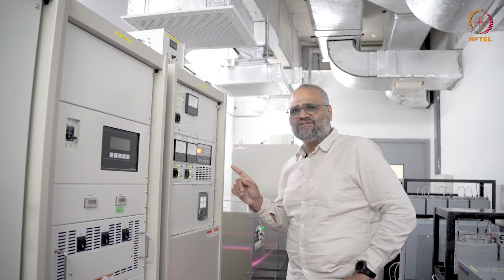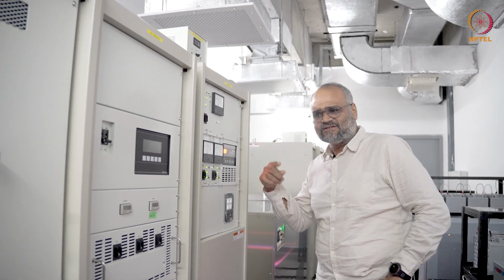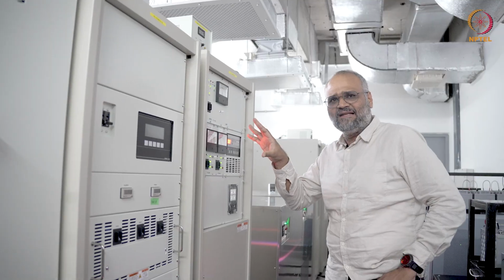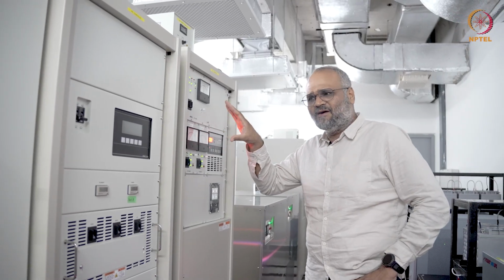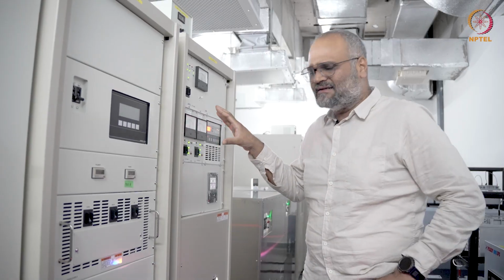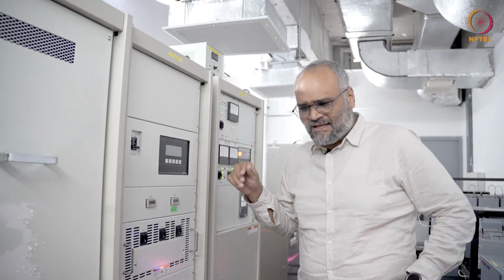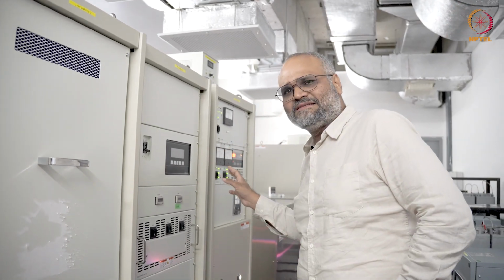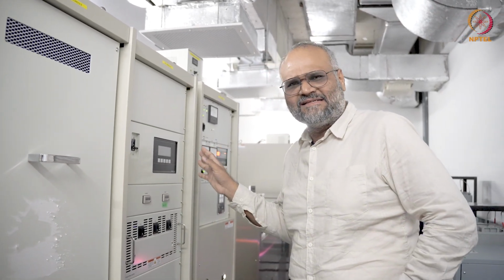Occasionally when you run into issues with rebooting the microscope system or resetting some of these power supplies, it comes in handy to know how these components look like, and you can usually come down here. This is just to give you an idea of how these accessories to run the aberration corrected TEM look like, and it is not essential that you always reset something unless it is necessary.